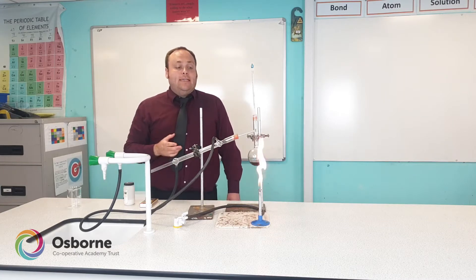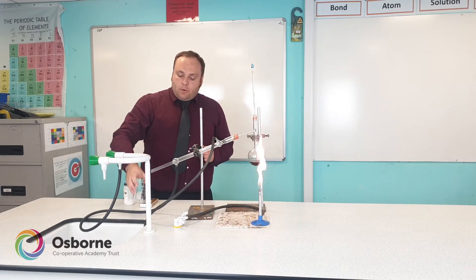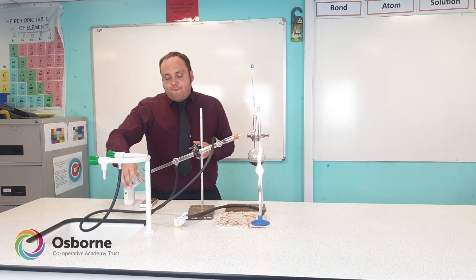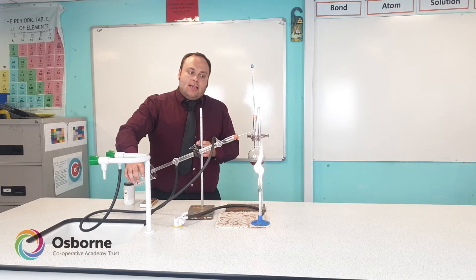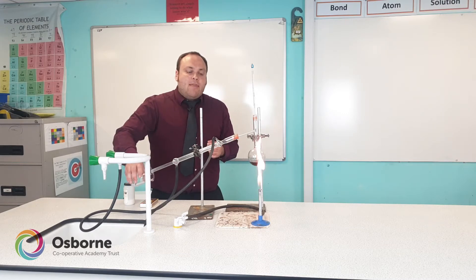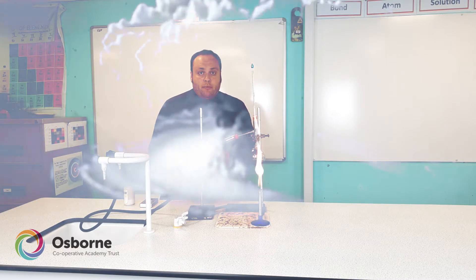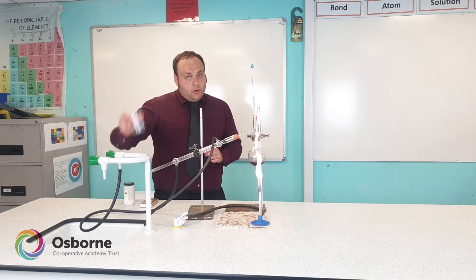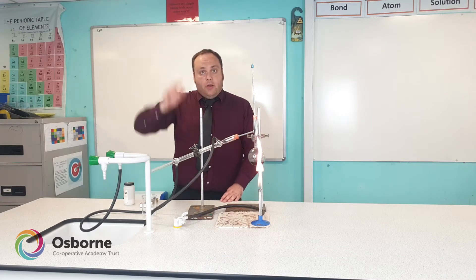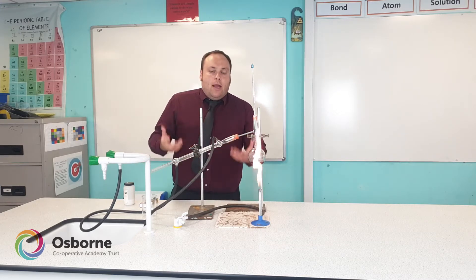At the other end of the condenser is where we collect the distilled water, so we need a flask or beaker to catch it. It's important to keep the distillation still an open system — we don't connect a bung or cork to this end of the condenser. If we created a closed system by boiling, there could be a dangerous build-up of pressure and the glassware could explode. We'll place a beaker underneath to catch the drips; some steam may escape to the atmosphere, but that's preferable to a face full of hot glass.